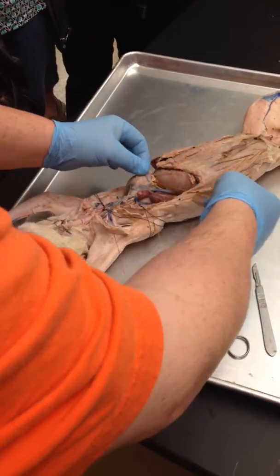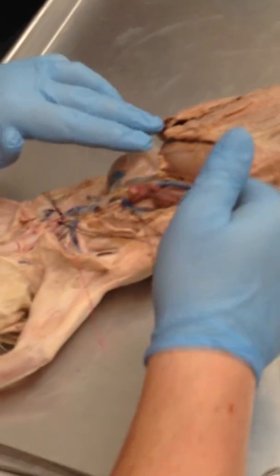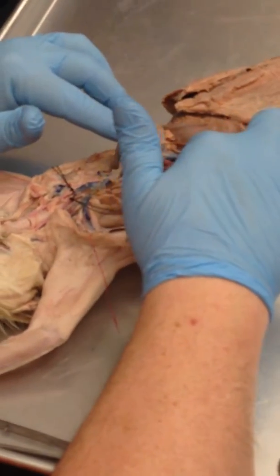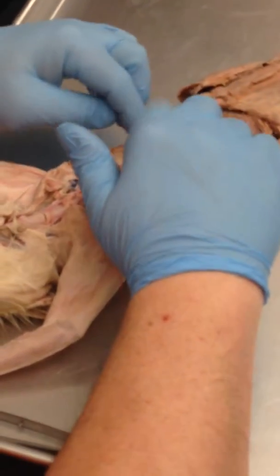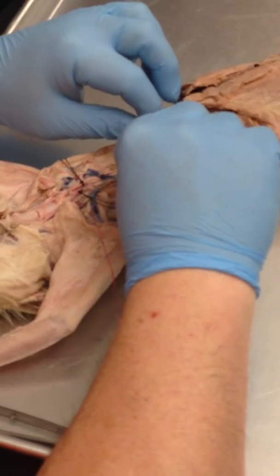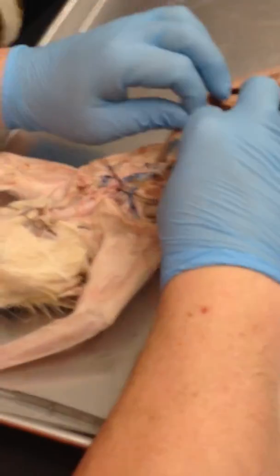As it runs to the pericardium, the phrenic, and this one is the gold here. It usually runs on the right side. It runs usually up and down the SVC, through the pericardium, down the IVC, on its way to the diaphragm. On the left side, I don't have the phrenic labeled on this one. I think it's cut out. I think they removed the pericardium entirely on this side.